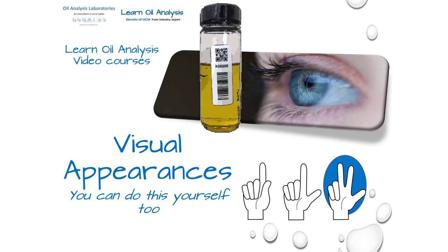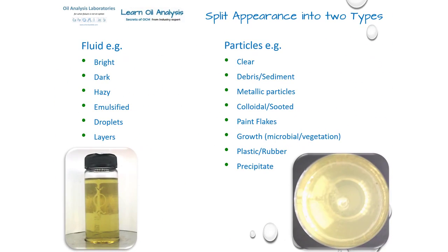To assess the appearance of a sample, I like to break it down into two parts: fluid and particles. This is why we take two photographs on our reports, one from the side and one from underneath, to catch both these aspects. A fluid can be bright or dark, hazy or emulsified, or even contain layers or droplets of other fluids. In terms of particles, the sample can be clear, or show visible debris or sediment. You can also see things like paint flakes, precipitates, and any metallic particles.